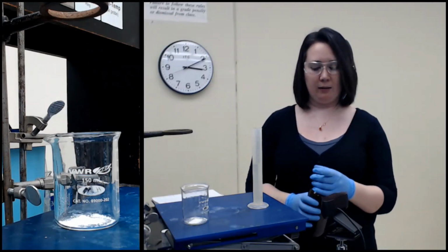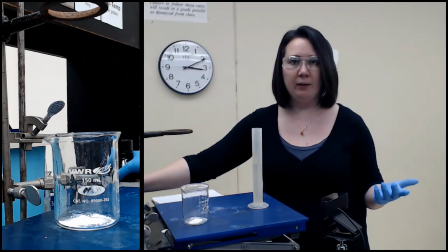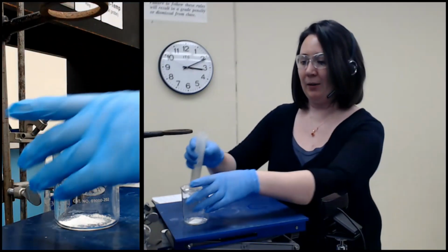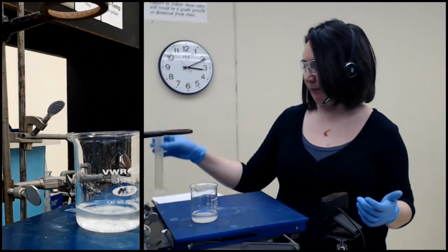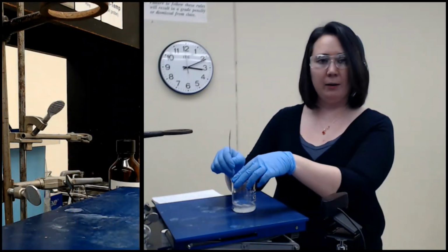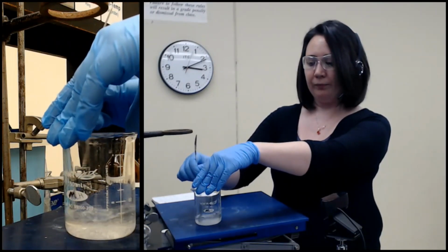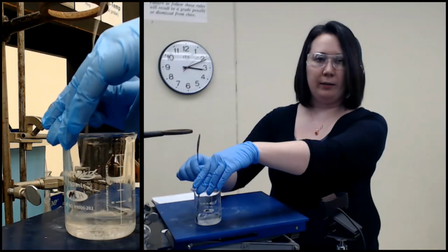I had one student volunteer to do a bit of research last spring, and they were kind enough to repeat this extraction experiment six or so times maybe, to prove that 1, the smaller amounts are going to work, and 2, that going from dichloromethane to ethyl acetate will also work successfully.